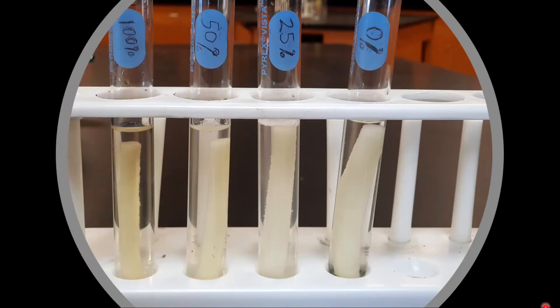After 24 hours, come back to the lab and observe. This is the result from the previous day. You can notice a difference in the length or thickness of the potatoes just by looking into the test tubes. The one with 0% sugar is really large in the test tube, and the 100% sugar solution is the smallest out of all four. Notice the size is decreasing going from 0% to 100%.